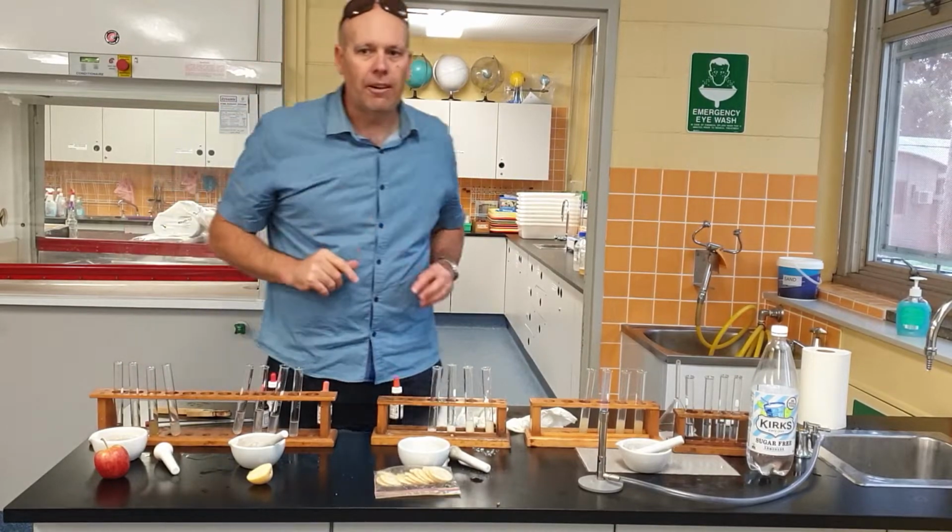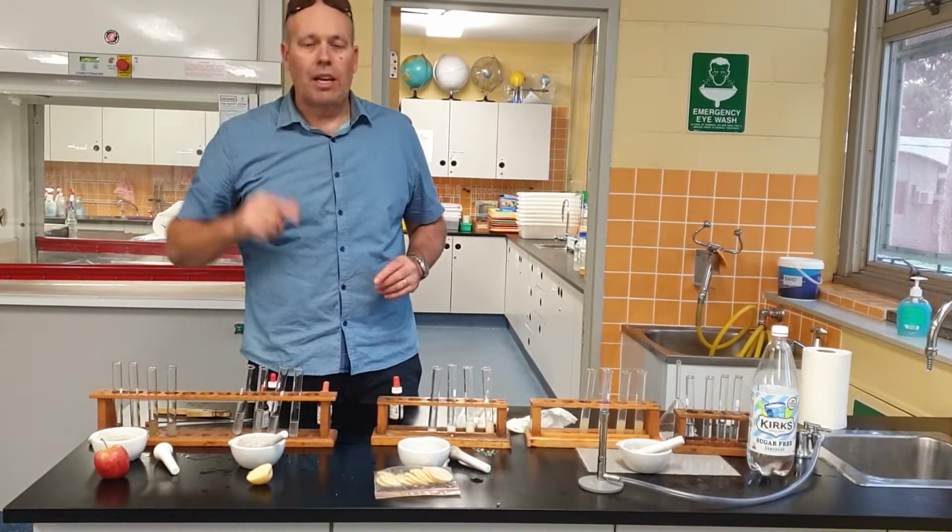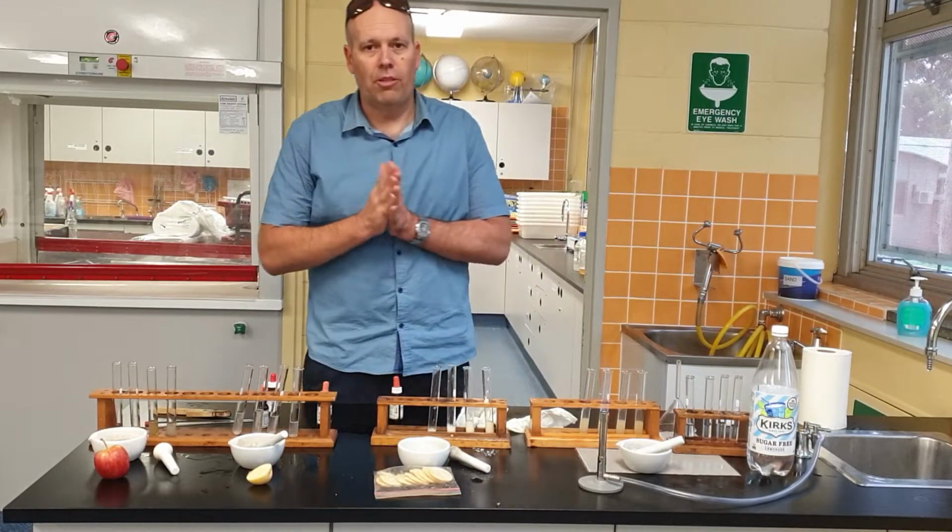Okay, so pause that video now and write down your results. Fill in your table, ticks and crosses for each of those chemicals that we find in apples.